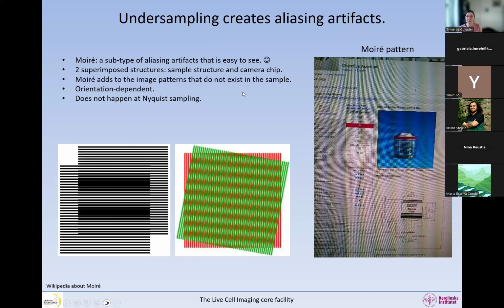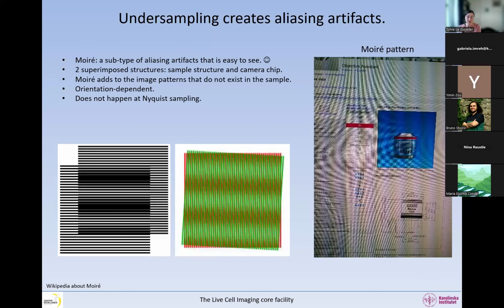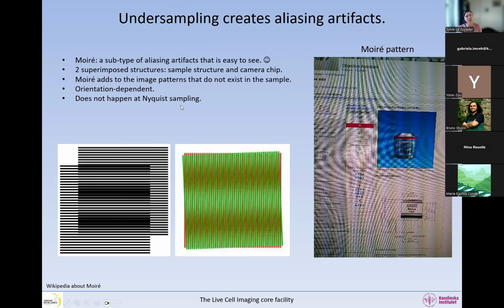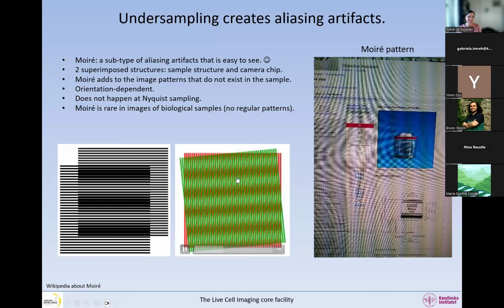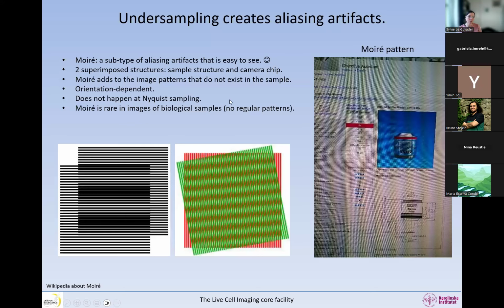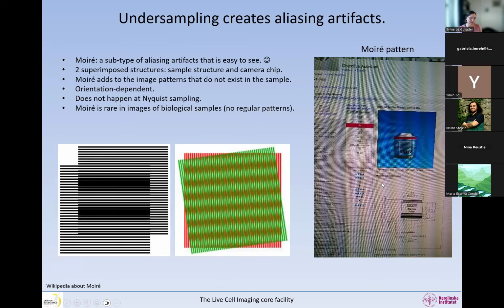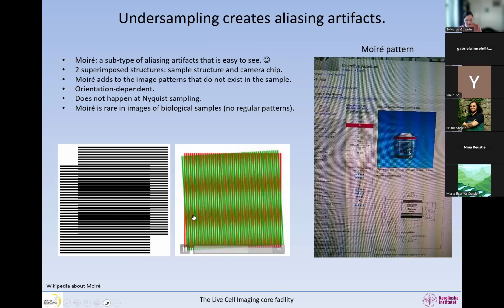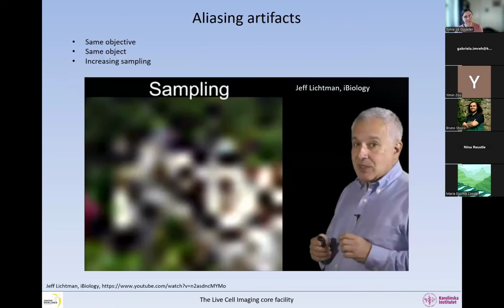You can see this type of moire artifacts in life everywhere. If, for example, you have a curtain made with fine structure and the light goes through, you may see some moire artifacts on the curtain. It's very common. Once you start seeing moire artifacts, you're going to see them everywhere. This does not happen at Nyquist sampling. Moire is rare in images of biological samples because biological samples do not have regular patterns. This happens very often in photography, for example, when you take a picture of a brick wall, or of someone who has a striped shirt.